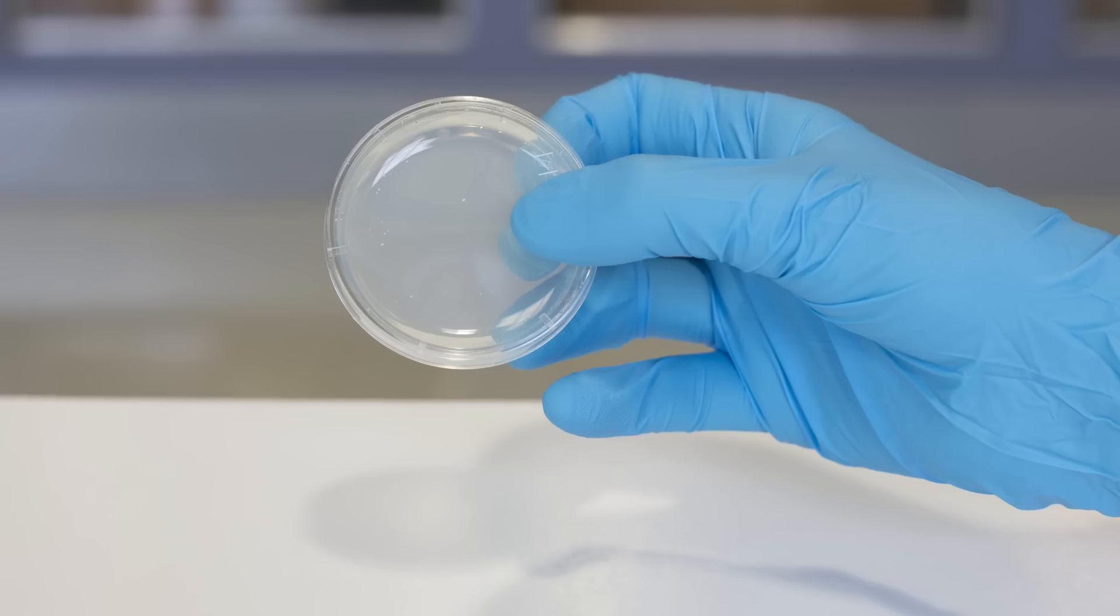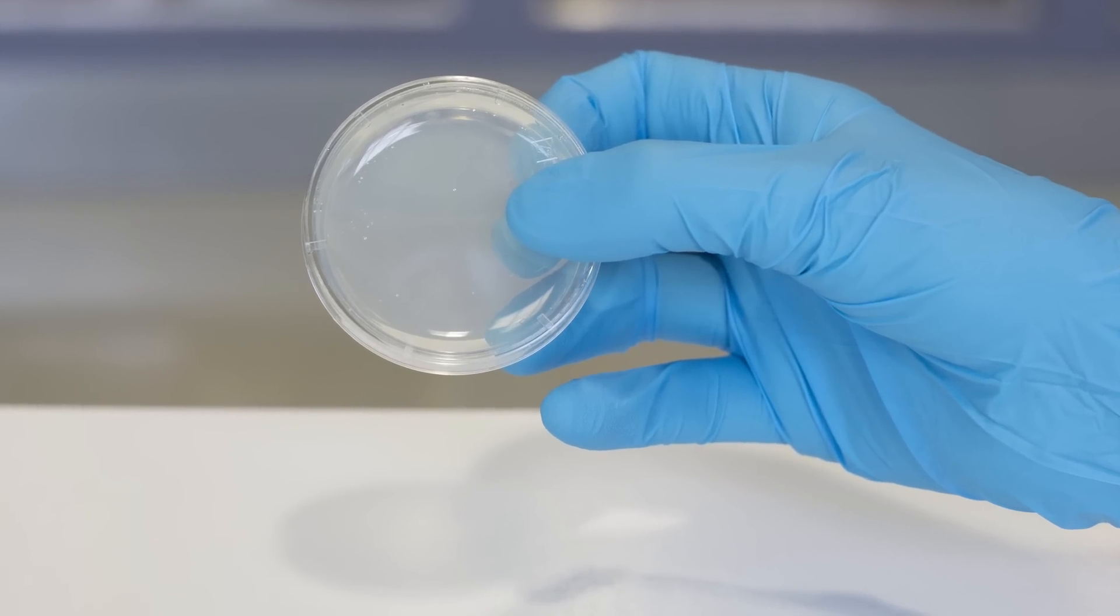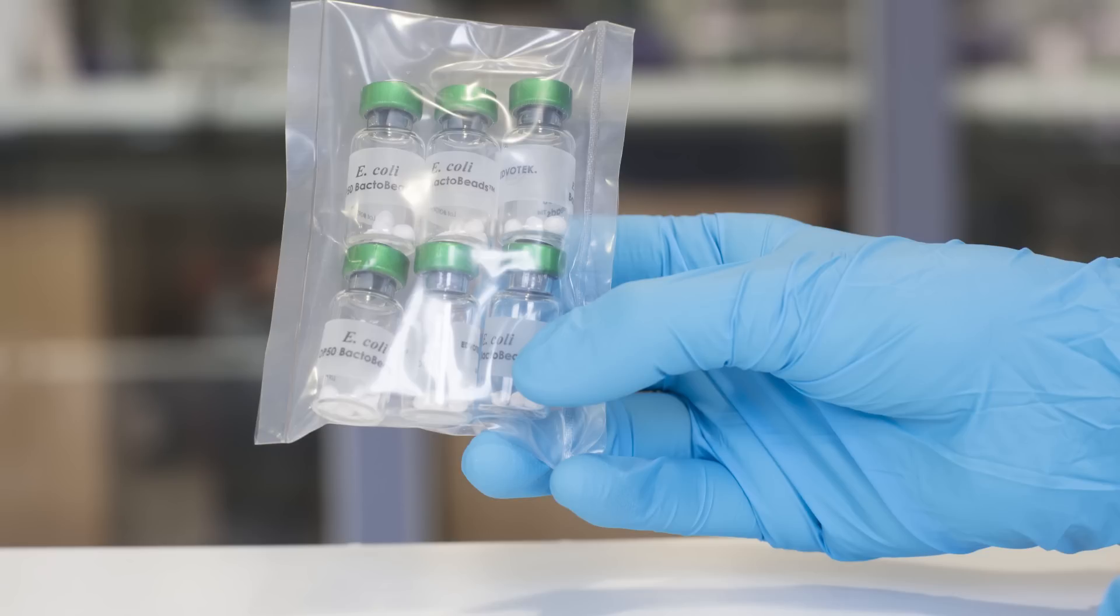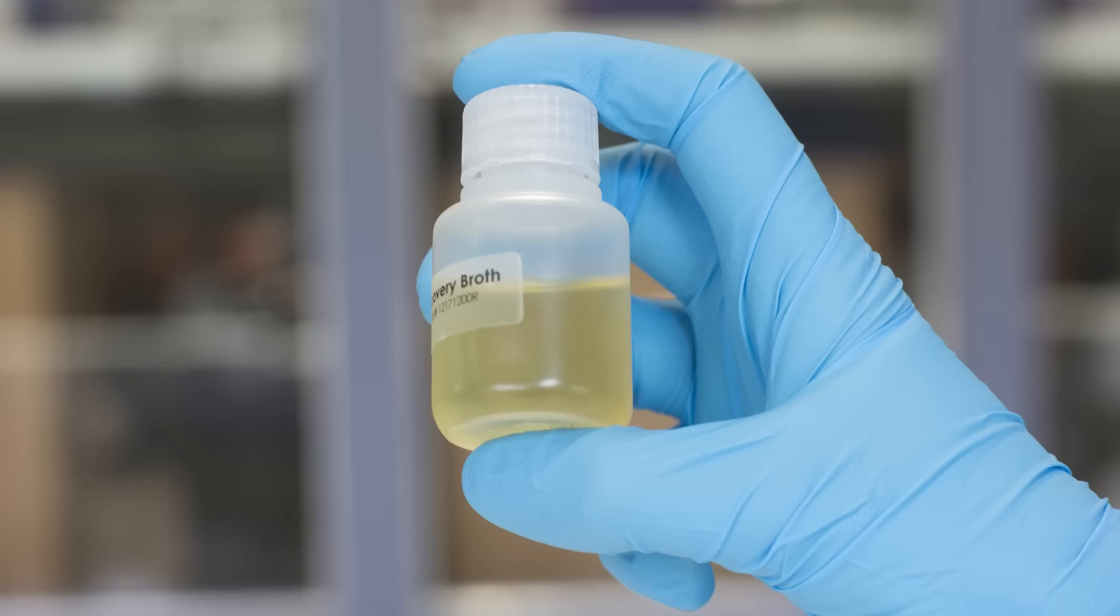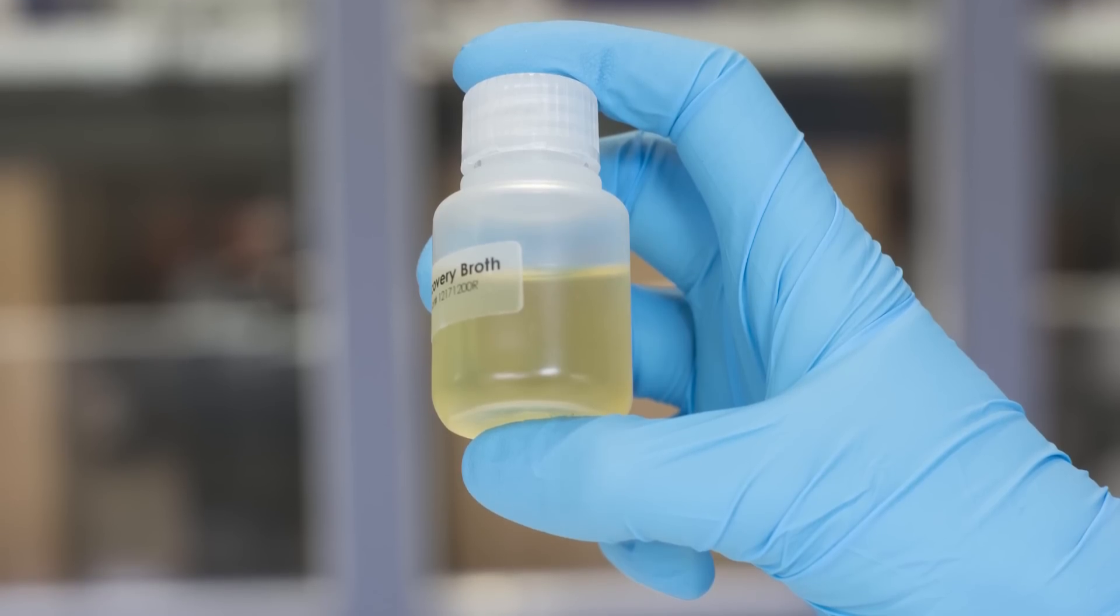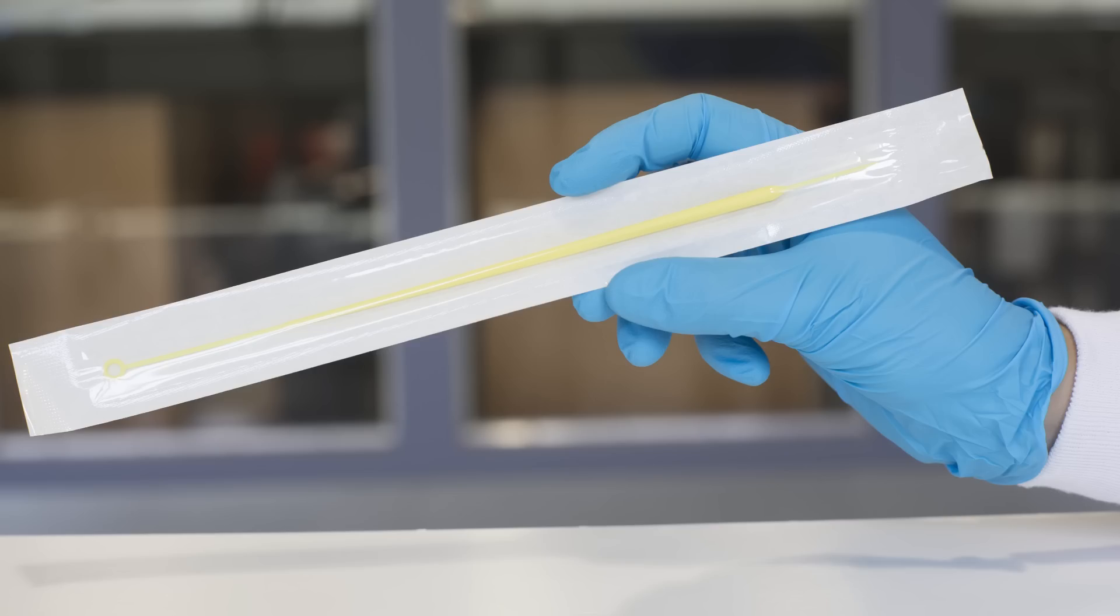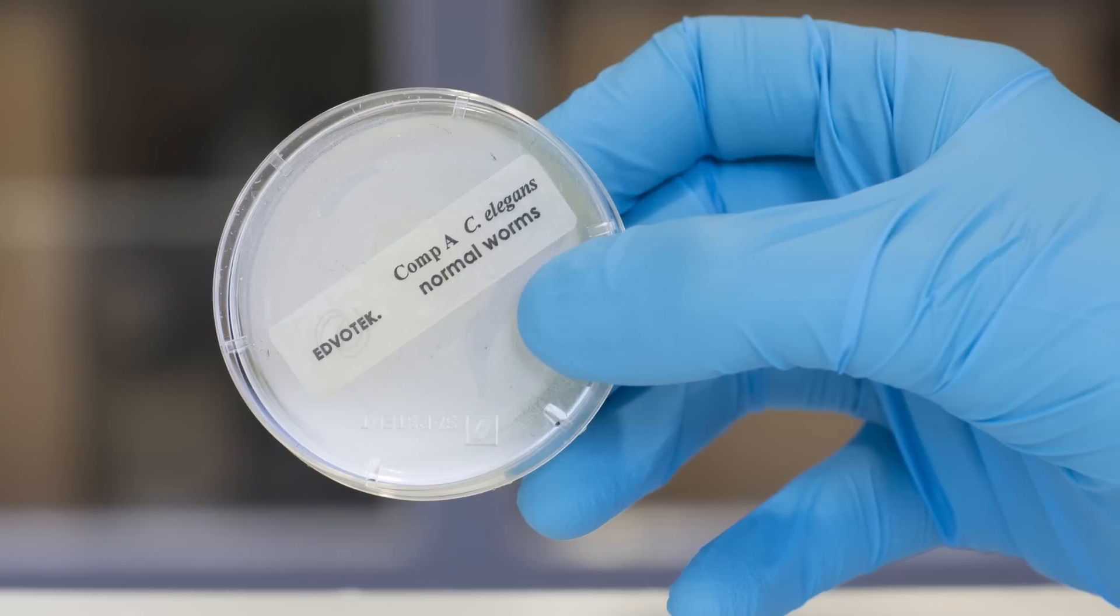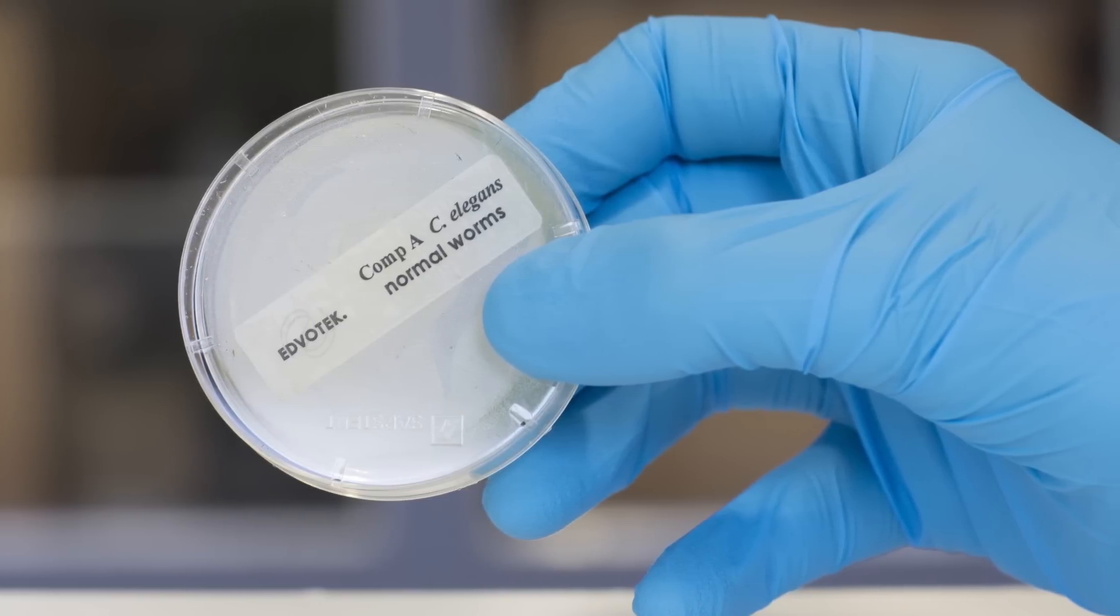For this experiment, you will need NGM agar plates, OP50 Bacto Beads, sterile broth or sterile water, sterile loops, and an NGM plate containing live C. elegans.